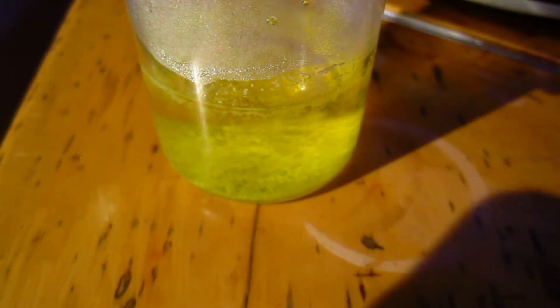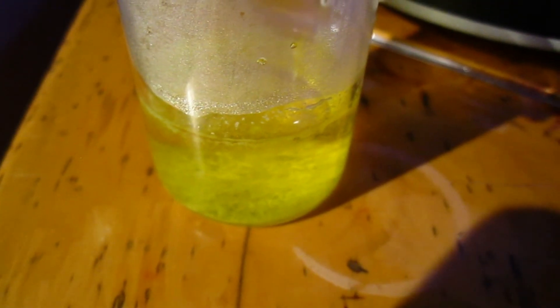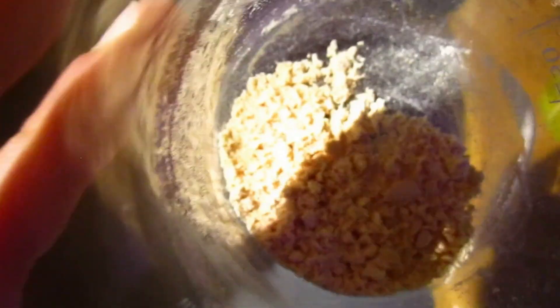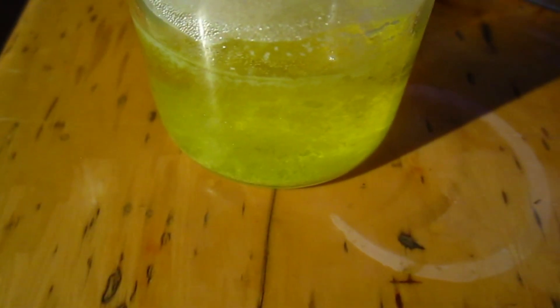I actually think that we got two isomers of the nitro-salicylic acid. This is probably the 3-nitro-salicylic acid and this is probably the 5-nitro-salicylic acid. This one is much less soluble and this one is quite soluble in hot water.